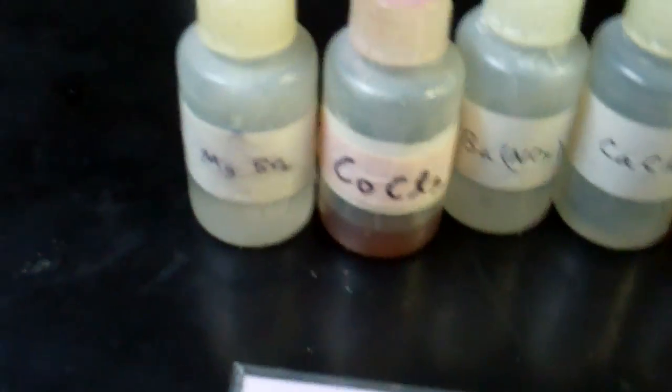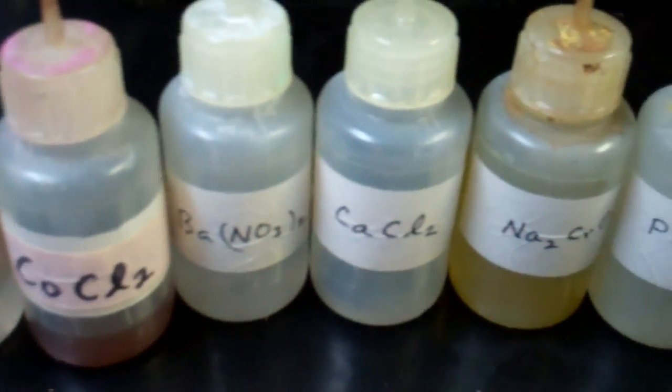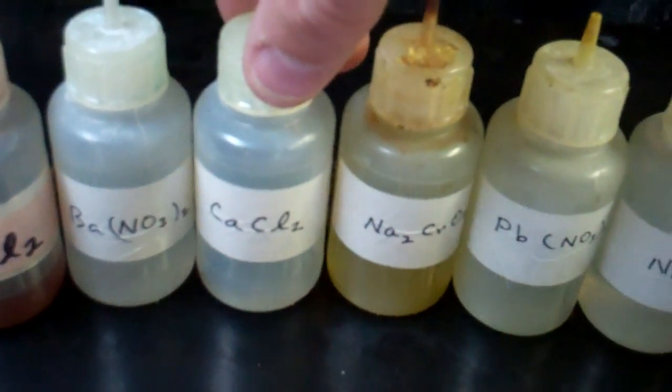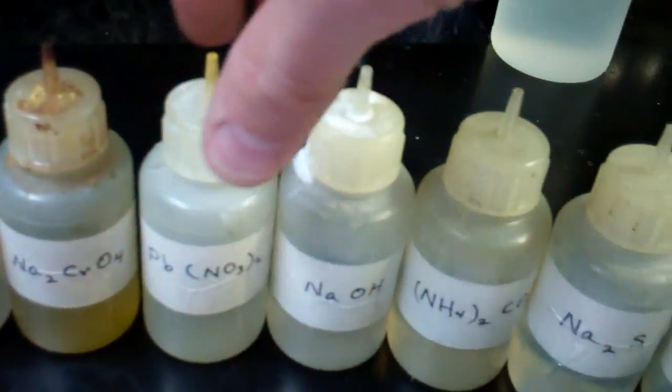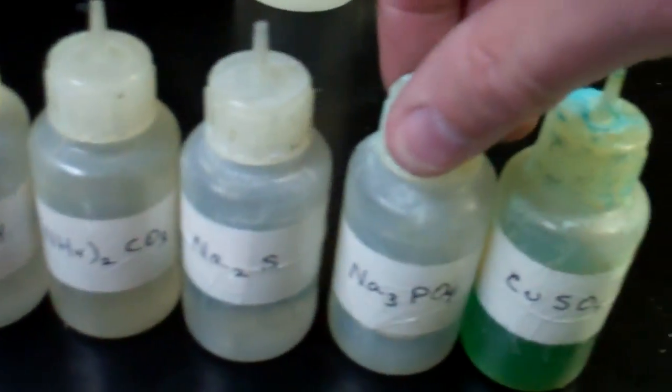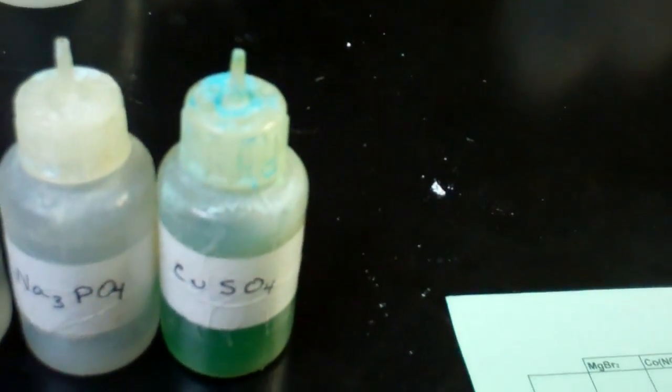You'll notice these solutions that we have out here. Well, I guess we could list them. Magnesium bromide, cobalt-2 chloride, barium nitrate, calcium chloride, sodium chromate, lead-2 nitrate, sodium hydroxide, ammonium carbonate, sodium sulfide, sodium phosphate, and copper-2 sulfate.